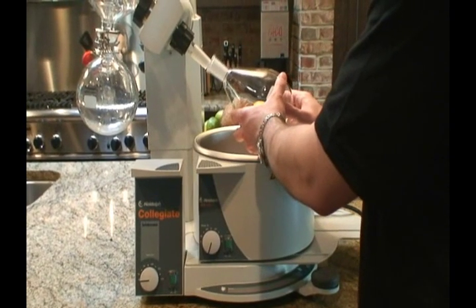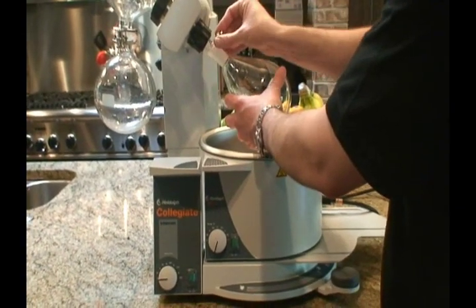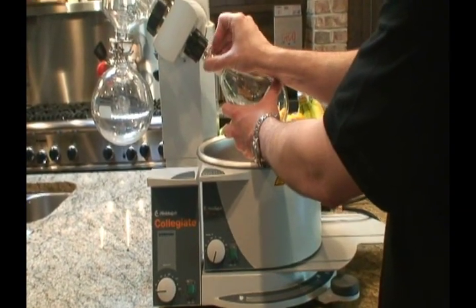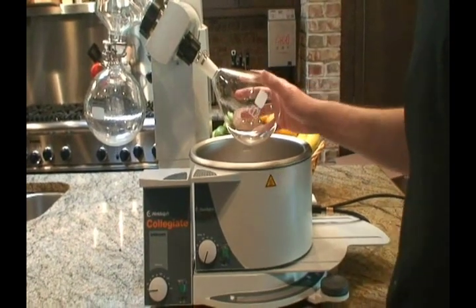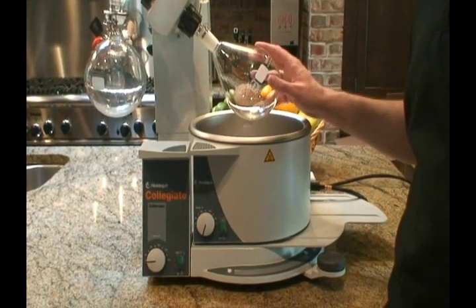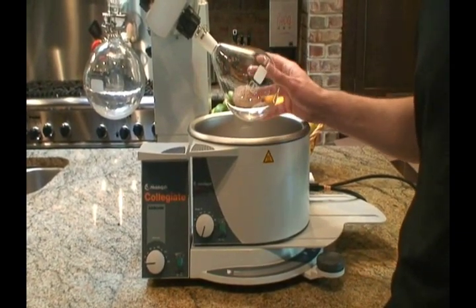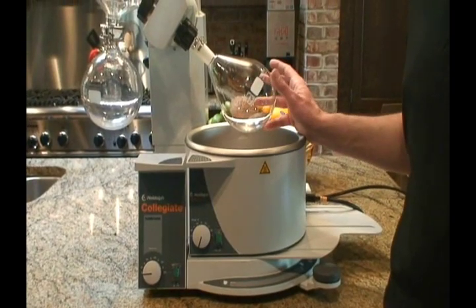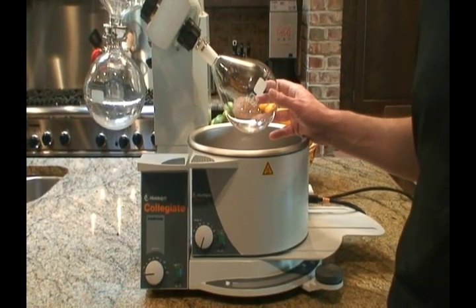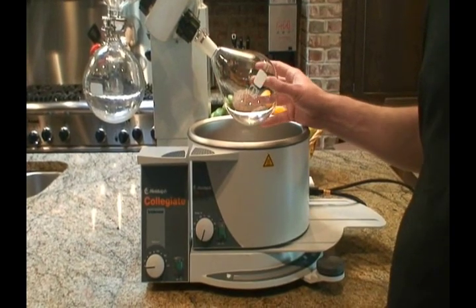While you're installing that, perhaps you could tell me — are additional size flasks available? Because I think I'm going to want to run more than a 1-liter sample. Yes, additional sizes are available. Larger than 1-liter would be 2-liter and 3-liter volumes, which would increase your work capacity. 3 liters is about 3 quarters of a gallon — that's pretty good.